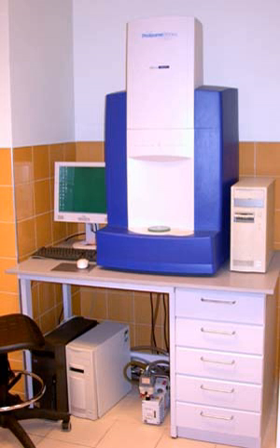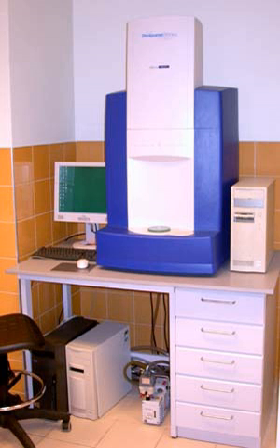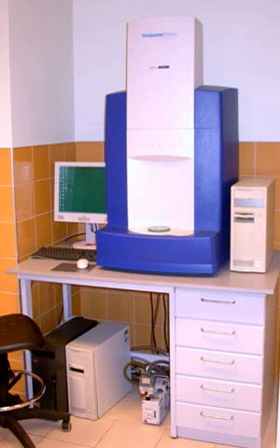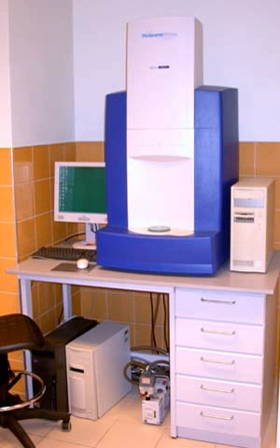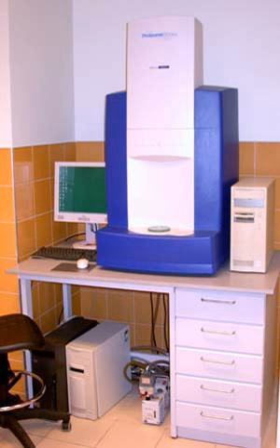The matrix solution is mixed with the analyte, e.g., a protein sample. A mixture of water and organic solvent allows both hydrophobic and water-soluble molecules to dissolve into the solution. This solution is spotted onto a MALDI plate, usually a metal plate designed for this purpose. The solvents vaporize, leaving only the recrystallized matrix, but now with analyte molecules embedded into MALDI crystals — the matrix and analyte are said to be co-crystallized. Co-crystallization is a key issue in selecting a proper matrix to obtain a good quality mass spectrum of the analyte of interest.